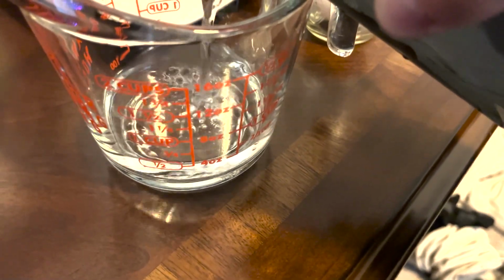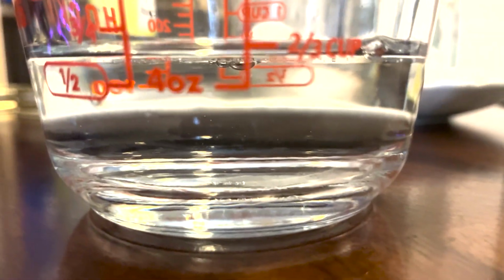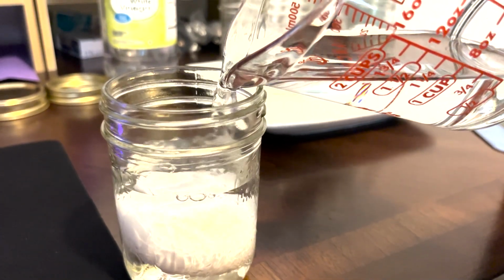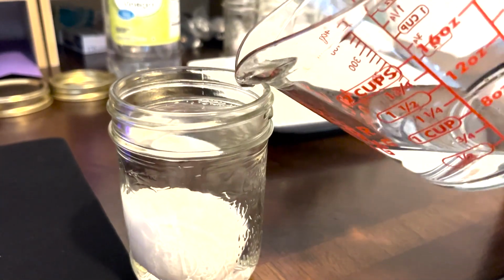Next, you're going to measure out the amount of liquid you are going to have for each of your trials based on the amount of vinegar or water that's going to be used. Make sure to take into account the eggs displacing the volume. First, you're going to take 100% water and you're going to pour that on top of the egg in the jar and then close the jar.